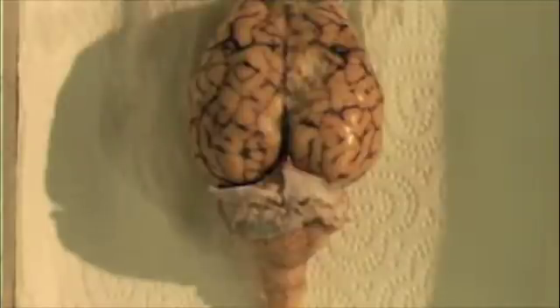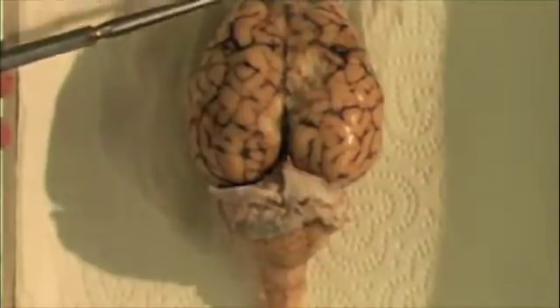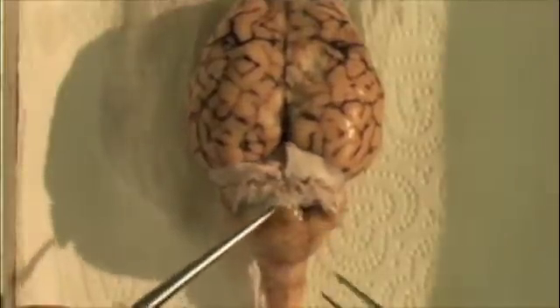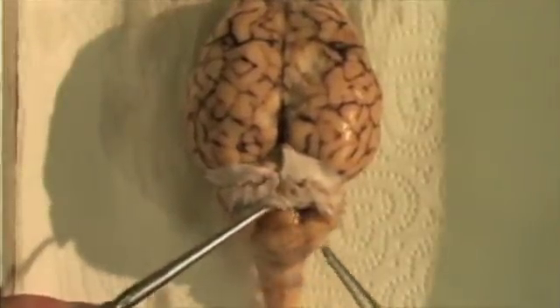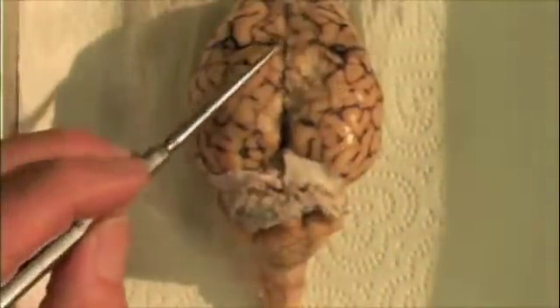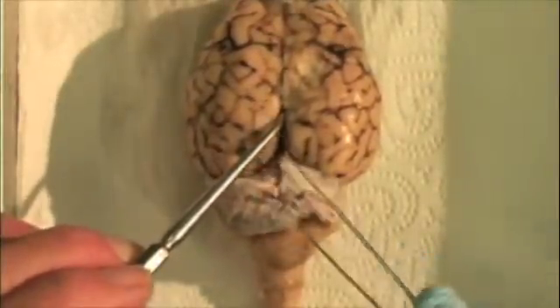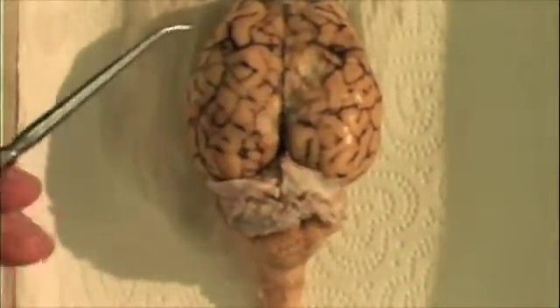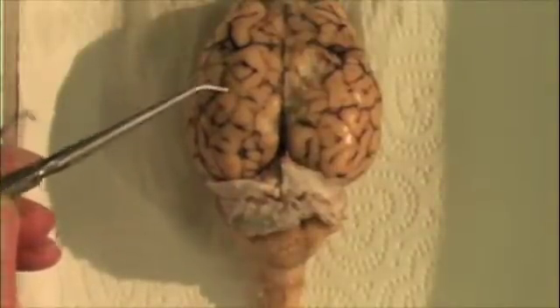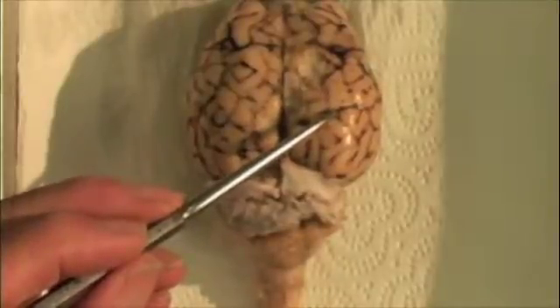Visible on the dorsal side of the brain is the cerebrum and the cerebellum. The two cerebral hemispheres are divided by the longitudinal fissure. The bumps are gyri — gyrus singular — and the grooves are sulci, or sulcus singular.